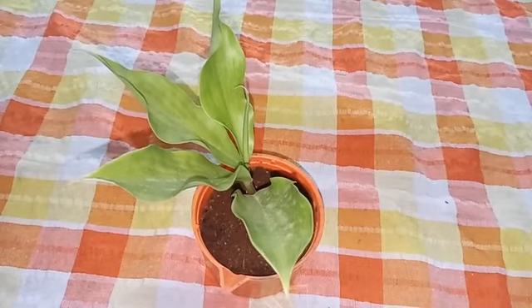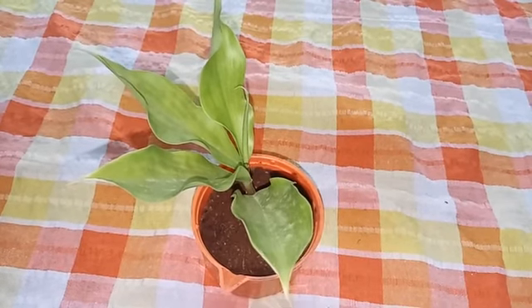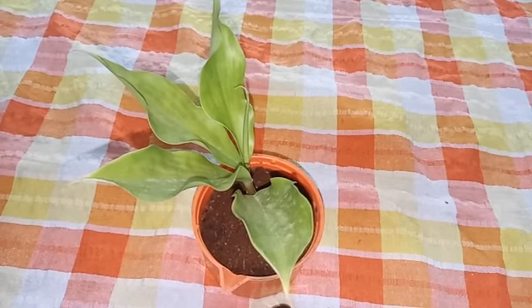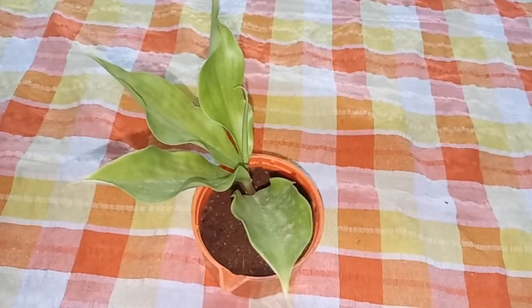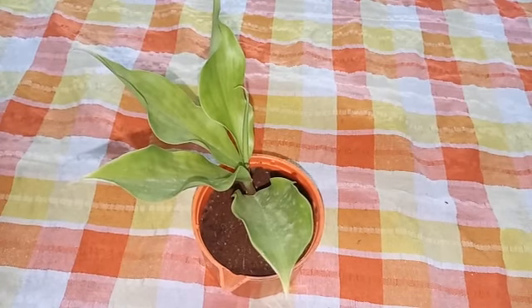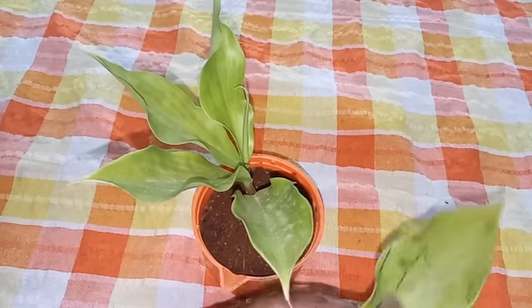If you conduct this starch test with iodine solution, the portion where the star-shaped cut is there, the outline, you can draw before conducting the test, though even if you don't draw the outline, the result will be like this only.